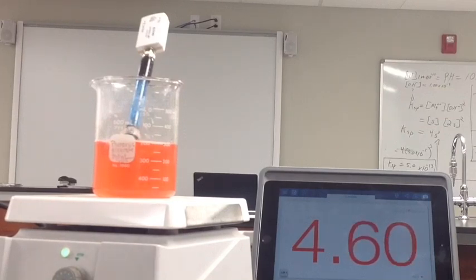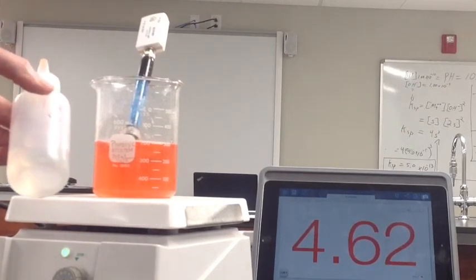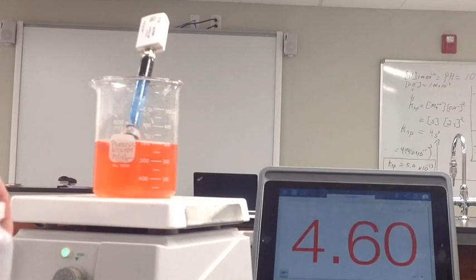Now you'll also notice that there is no more solid in here. There's no magnesium hydroxide solid. What's floating around in here now? Well, we've got lots of water, obviously, lots of solvent. Now we also have excess amounts of H positive compared to hydroxide based on the pH. We know that. What else is present? Magnesium double positive ions are still present. Again, the solid magnesium hydroxide is completely dissolved.